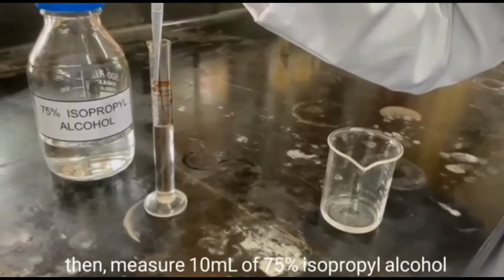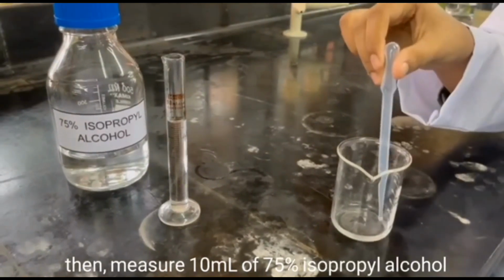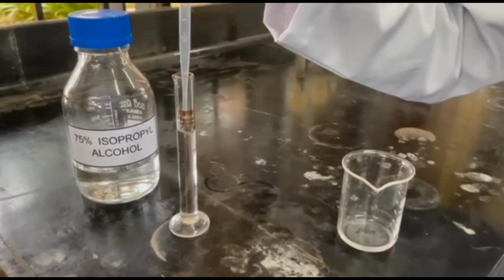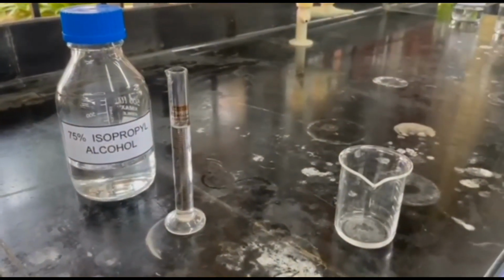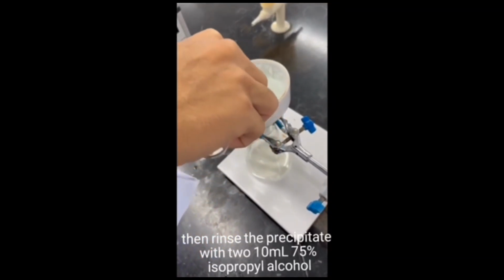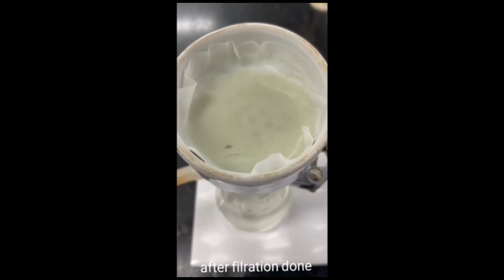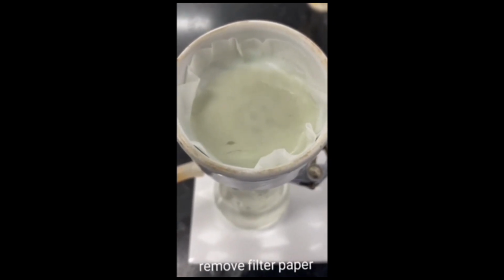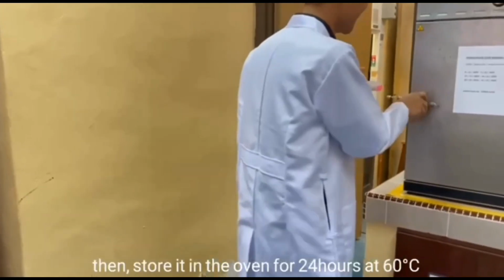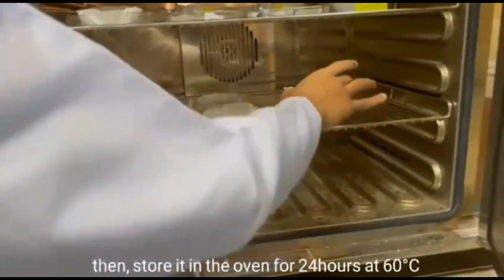Then measure 10 ml of 75% isopropyl alcohol. Then rinse the precipitate with 2 portions of 10 ml 75% isopropyl alcohol. After the filtration is done, remove the filter paper and place it on a porcelain evaporating dish. Then store it in the oven for 24 hours at 60 degrees Celsius.